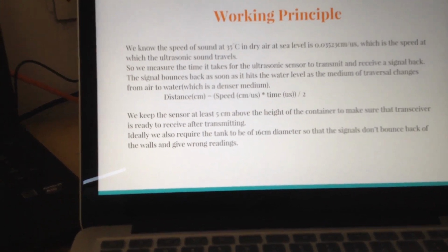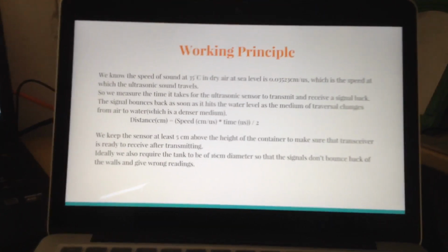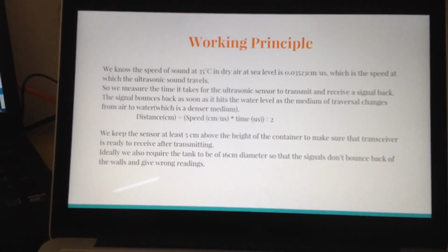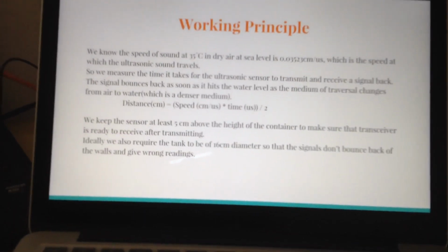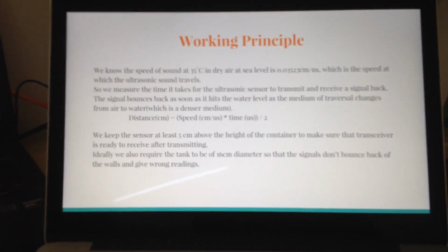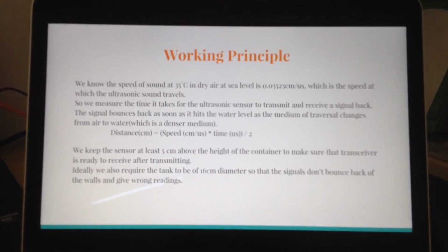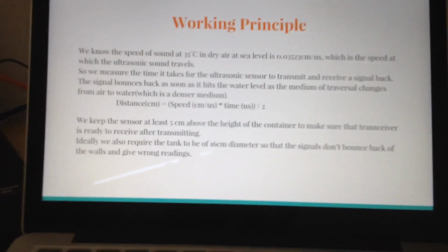The basic principle which is used is that we know the speed of sound. We can assume that it is uniform, and our well-known friendly formula, speed is equal to distance upon time. We've used that, and so basically the sensor emits a sound signal and waits for it to come back. So it is essentially a transceiver. So we measure the time interval which it takes for this process to happen, and since we know the speed of sound, we are able to calculate the water level, and we have written code to ensure that if the water level falls below a certain ideal level, then we trigger a call using the GSM.